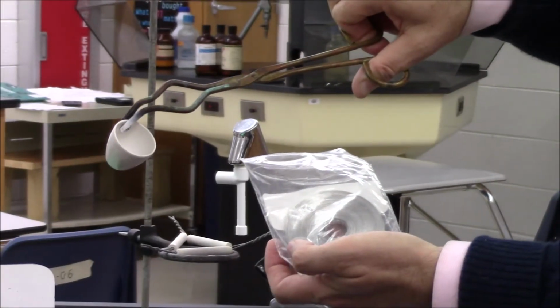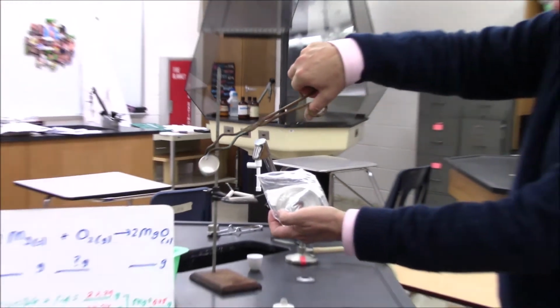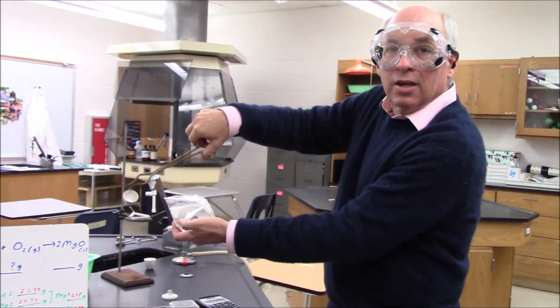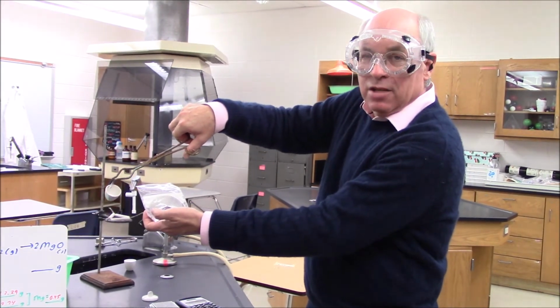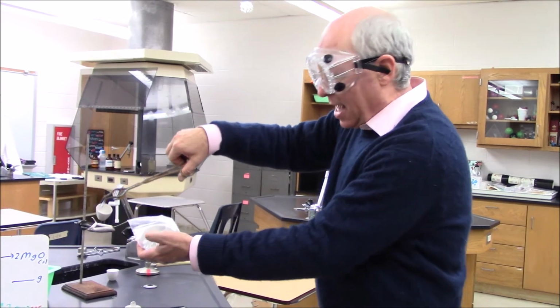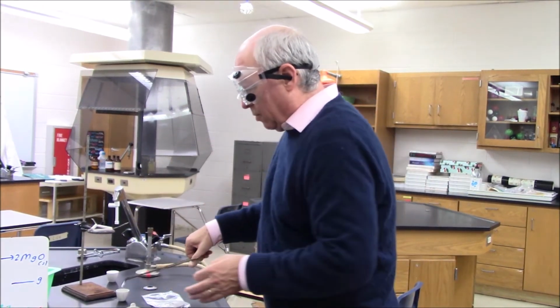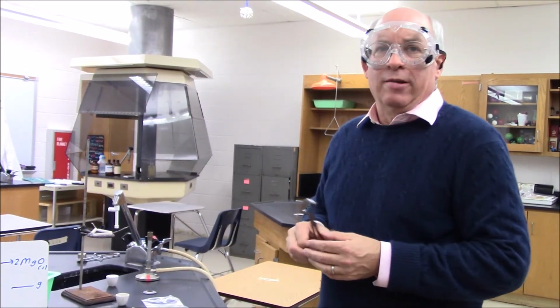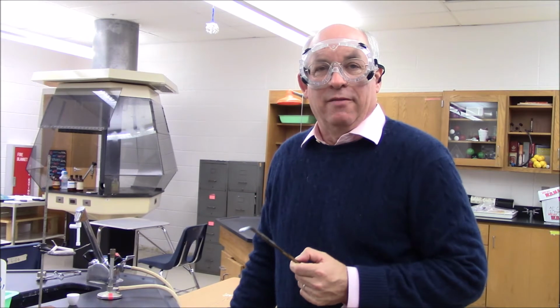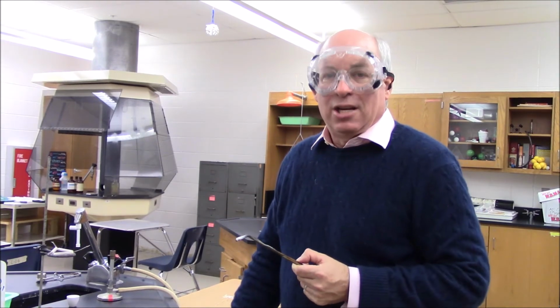We had several indications that a chemical change took place. We saw light being given off. We saw a pretty impressive chemical color change. One thing you might have noticed was there were little white sparks coming out, and that might remind you of something you see in fireworks, because magnesium is often used to give those nice white flashes.